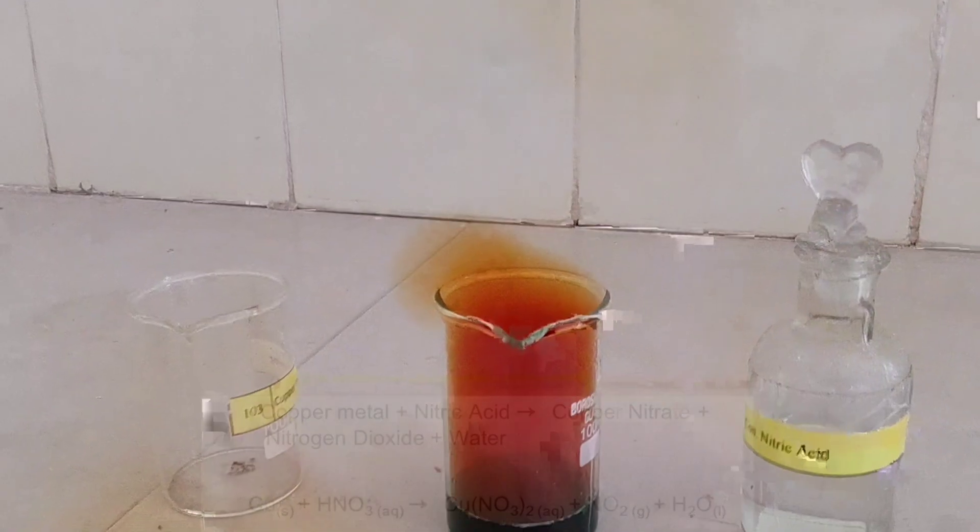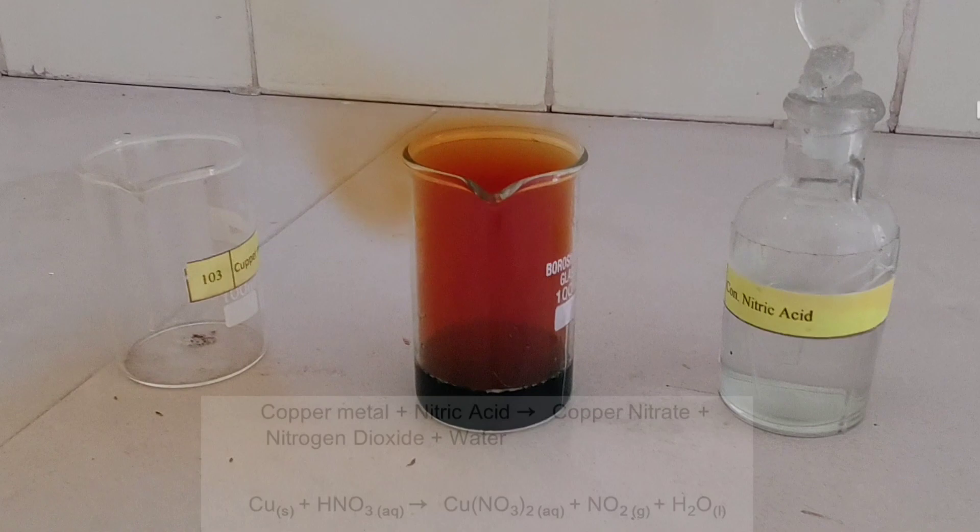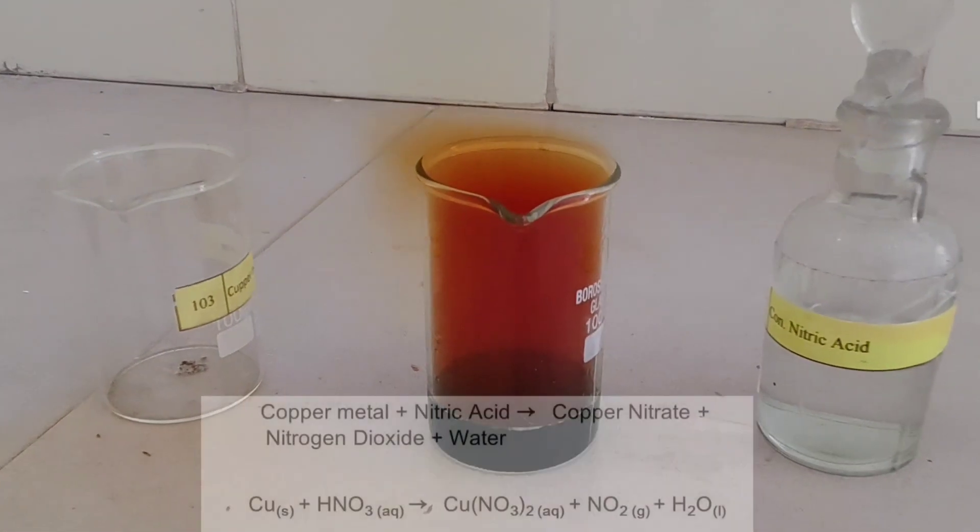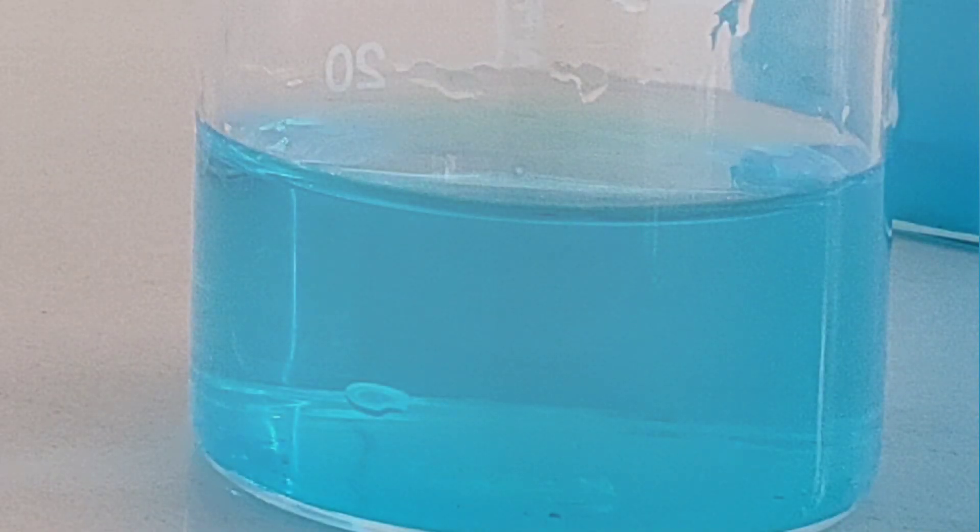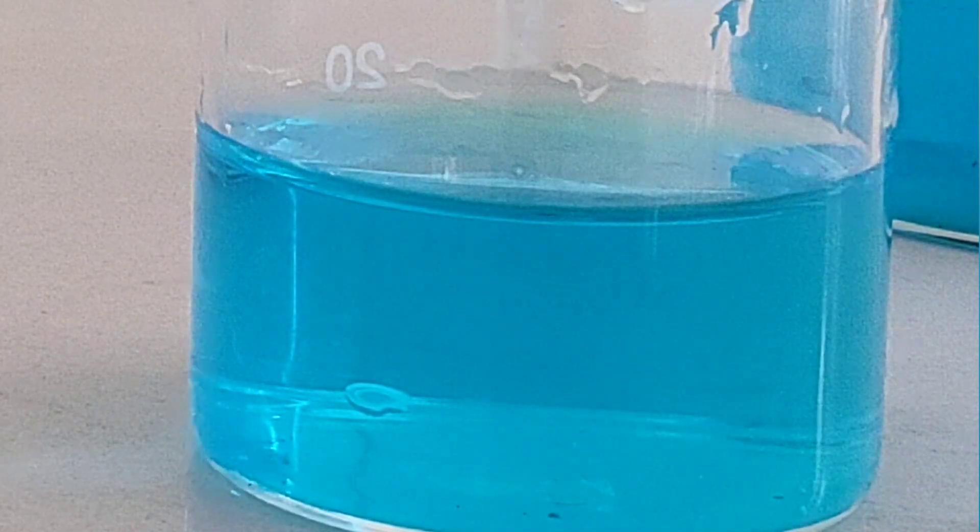The result is that the metal dissolves, and a solution of copper nitrate forms. The copper nitrate gives the solution a green or blue color. This will depend on the amount of water used.